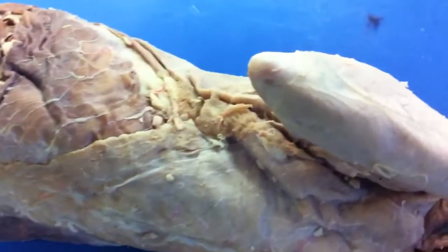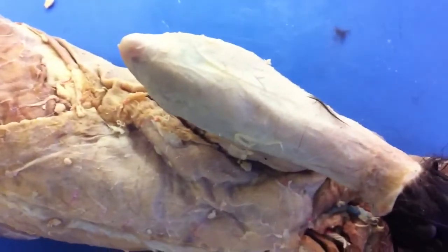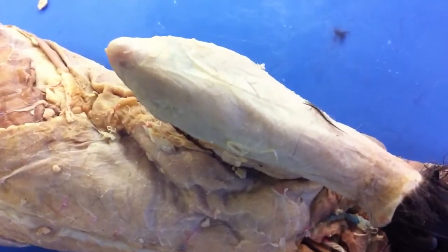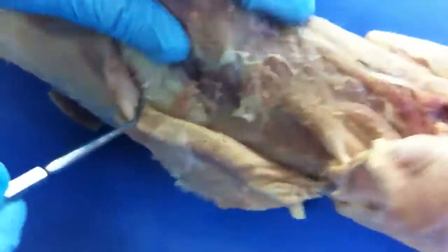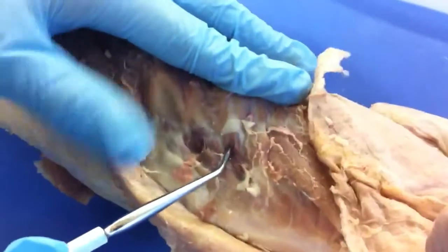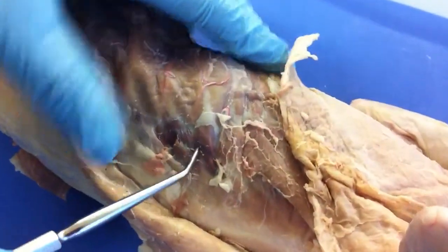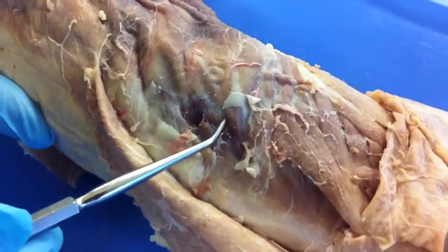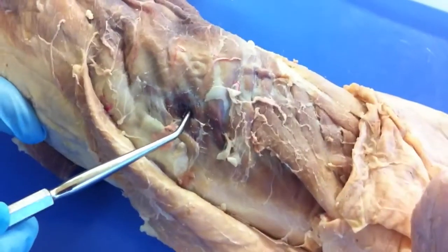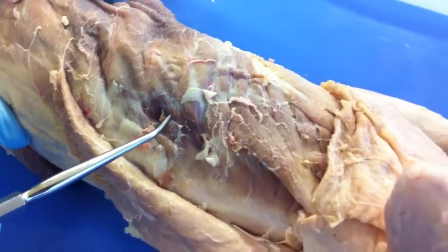We also have the rectus abdominis. The intercostals are basically the ones surrounding the ribs — they're the ones that help control rib expansion. So if you see anything going around the ribs, those would be them. The internal intercostals are the ones just deep to those.